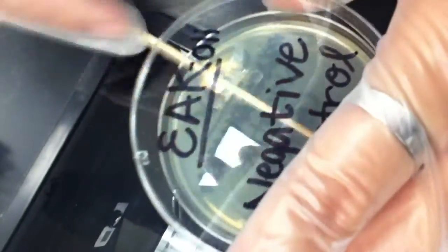Okay, so Kim is swabbing right now. As you can see. Good job. Swab, swab. I'm gonna swab this one, okay?